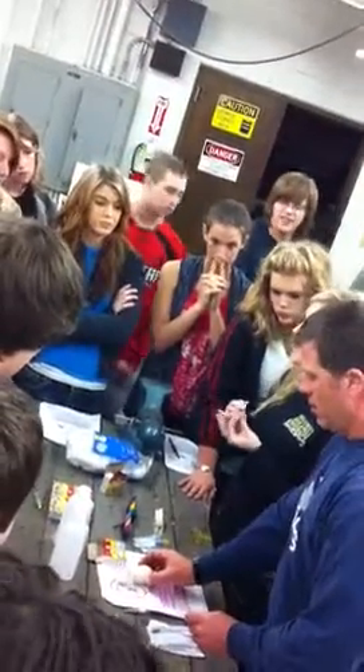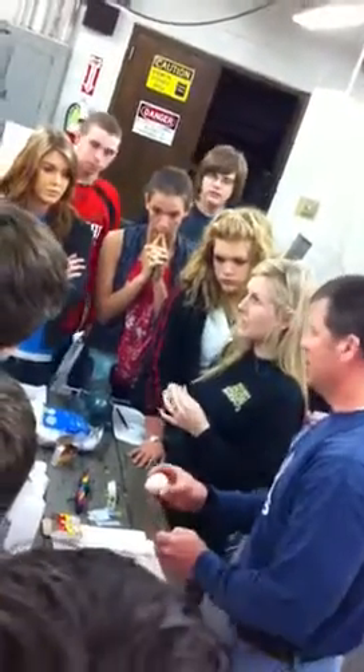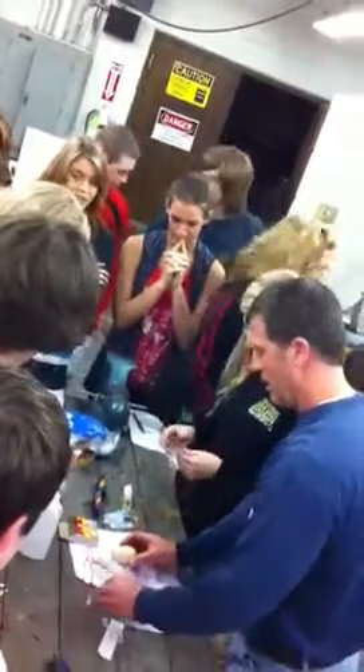Are there any questions before we begin? Is that a dead egg? Yeah, y'all can inject it if you want to practice like this. Anybody want to practice? I want to practice — just like inject 700 million.